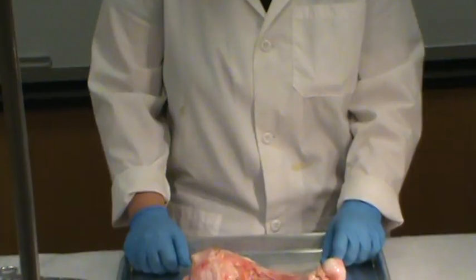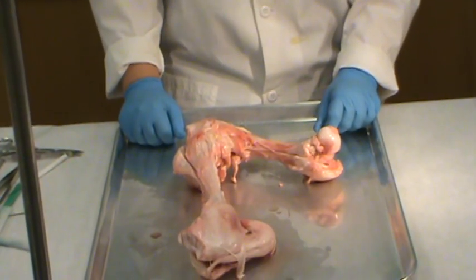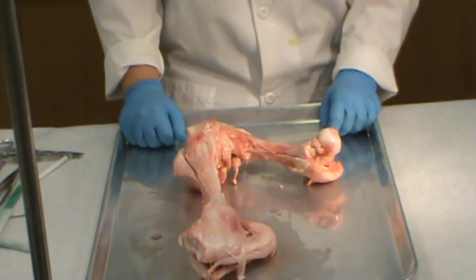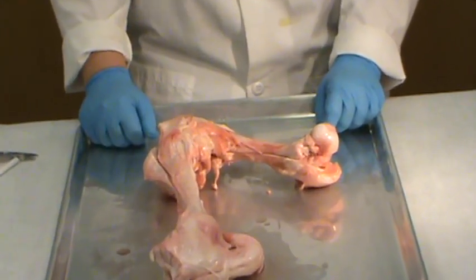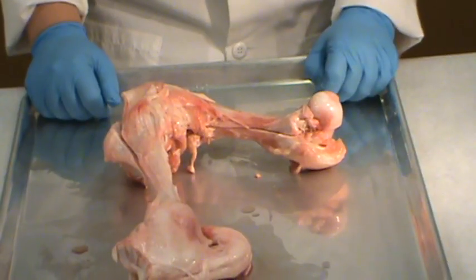Hi, I'm Dr. Hayes. This is the split femur dissection at North Seattle Community College today. This split femur is from an animal that walks on four legs, so it's going to be a little different than what you see in humans because humans are bipedal. But there will be enough similarities in the comparison for you to understand both bones and joint structures.